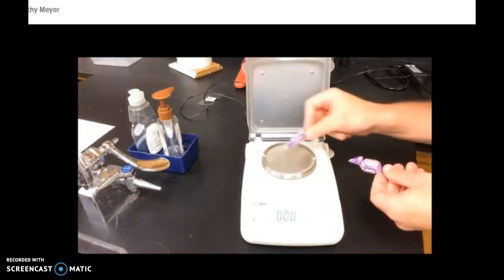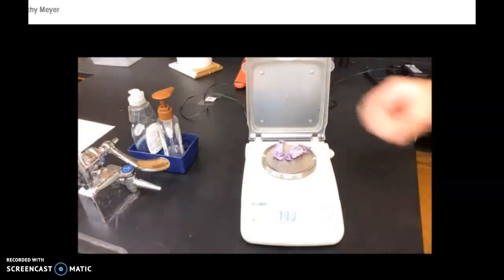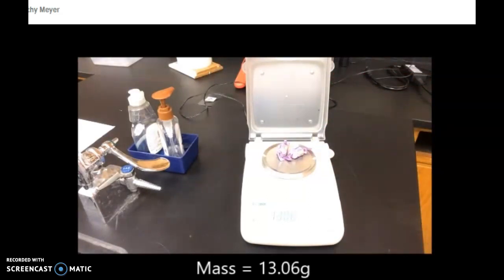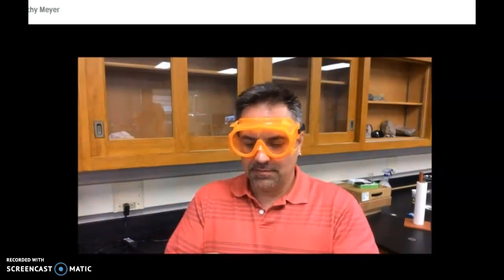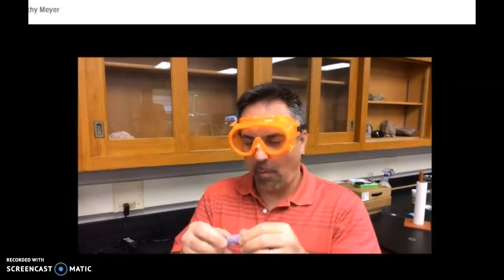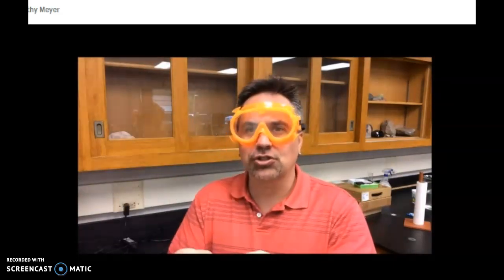I'm going to start off with two pieces, do the same exact thing, but just double the amount. One piece. Two pieces. It's like torture.